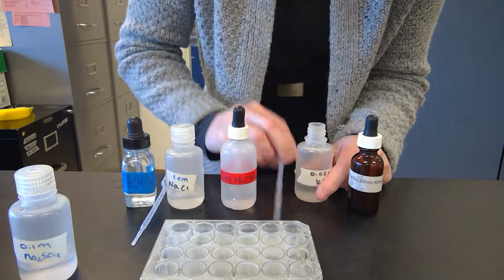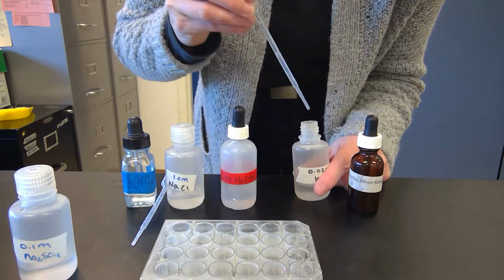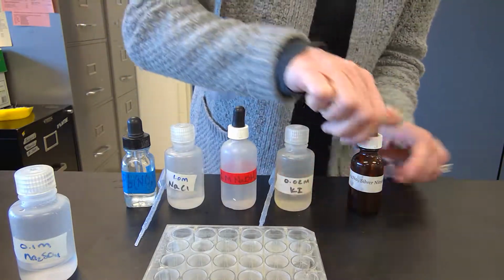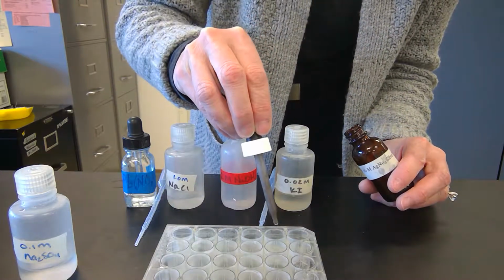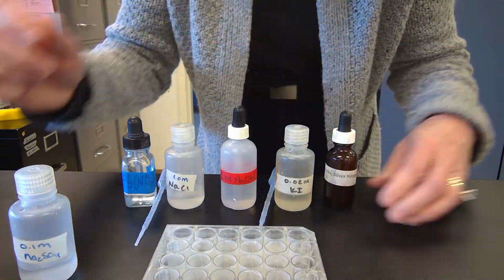Potassium iodide, not much. Maybe a little bit chunky, but that might just be dirt on my tray. And then silver nitrate is my last one. Okay, and that's not much, maybe a teensy bit bubbly, but not much.